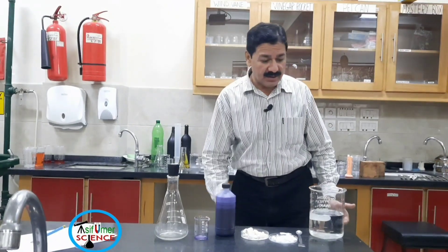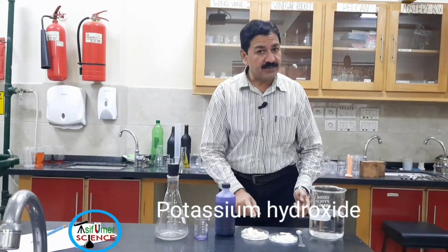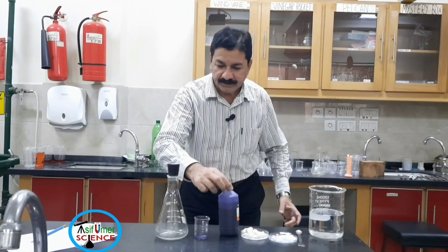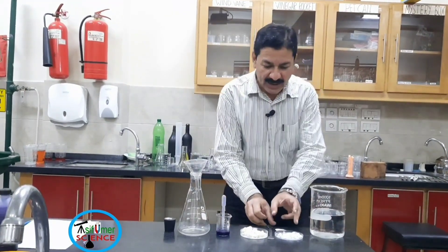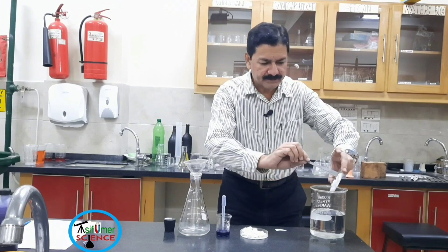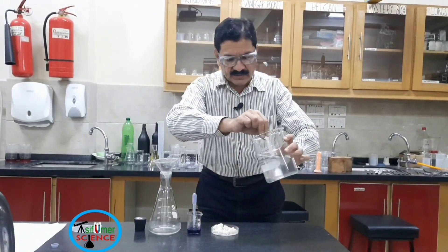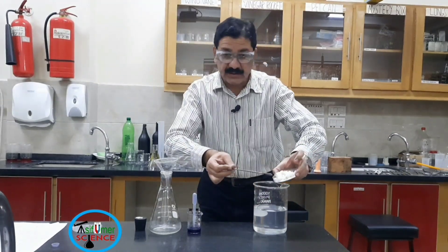For this activity, the required things are 600 ml water, spatula, 16 grams potassium hydroxide, 20 grams glucose, and a few drops of methylene blue indicator, and a conical flask with stopper. The first step is I am going to add potassium hydroxide in 600 ml of water. Potassium hydroxide completely dissolves in water.